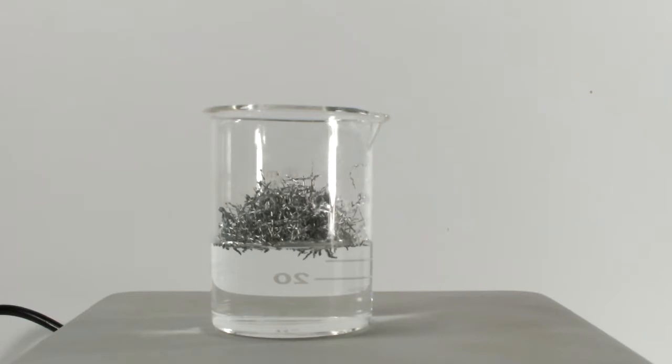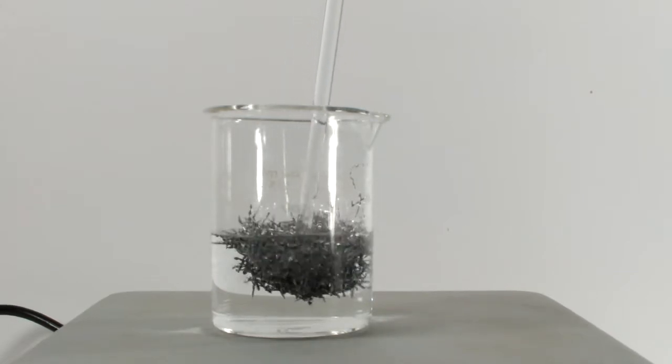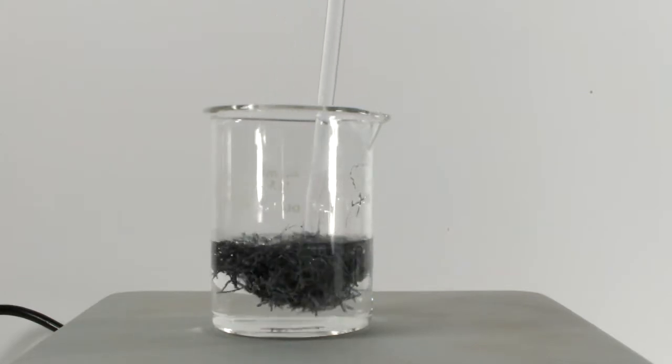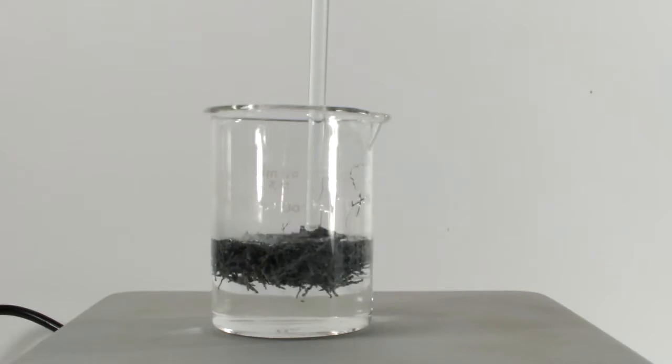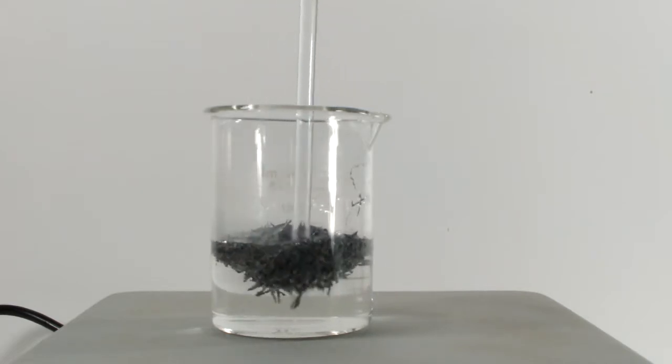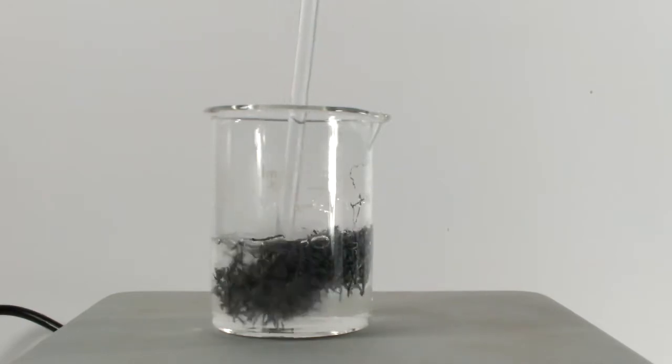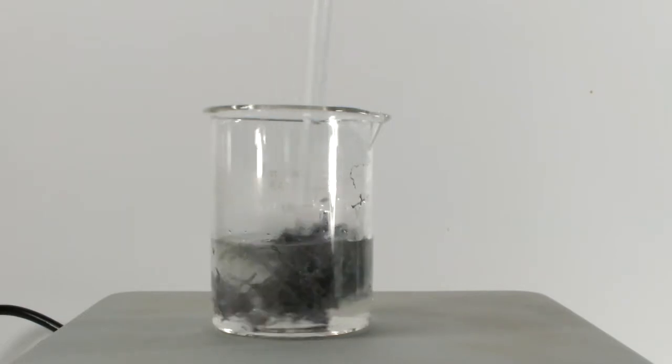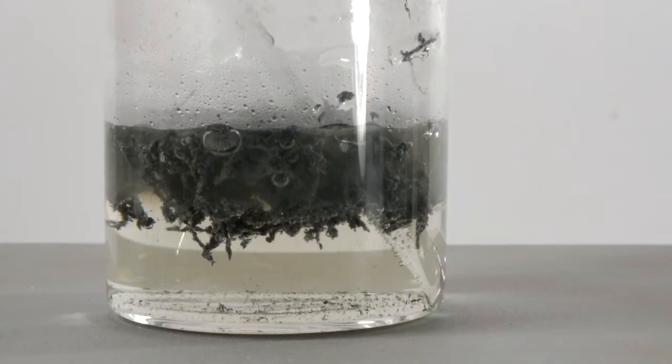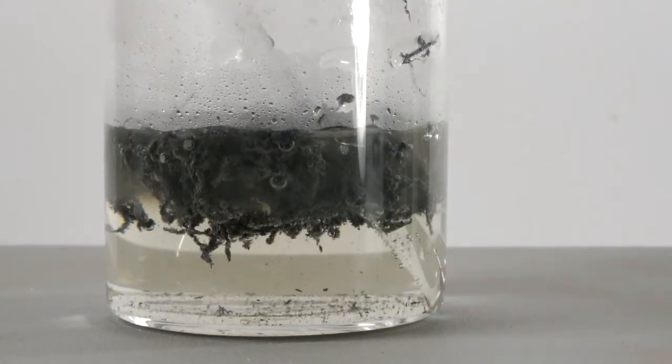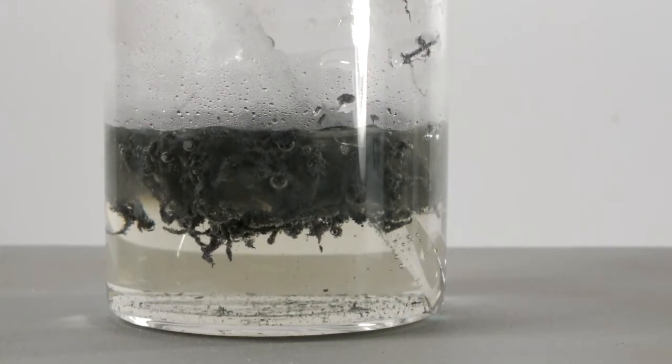There wasn't a violent reaction, so I figured, let's get this party started. I didn't measure the mass or anything, so this is basically just for fun. There is a slight delay to the reaction getting started, but lead crystals do start to form, and there's an evolution of gas, I'm guessing hydrogen. After mashing it around for a little while, I just left it to sit and react for a couple minutes. And then I wanted to come back and give it another stir and see what happened in that amount of time.